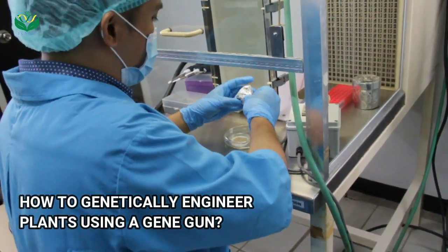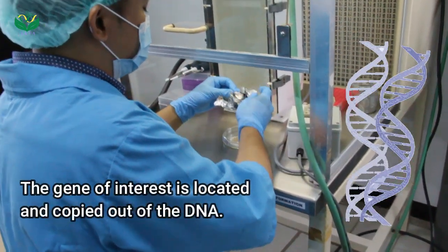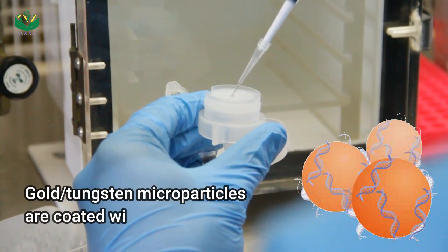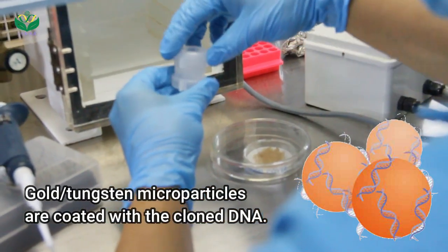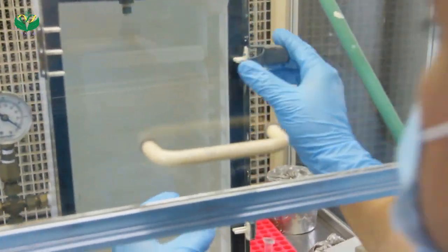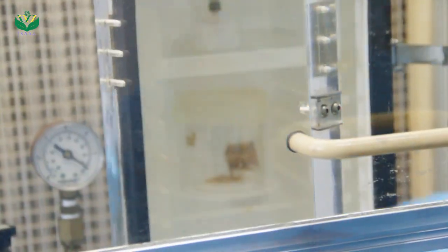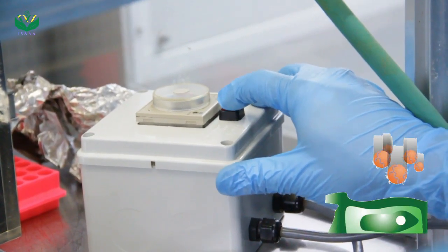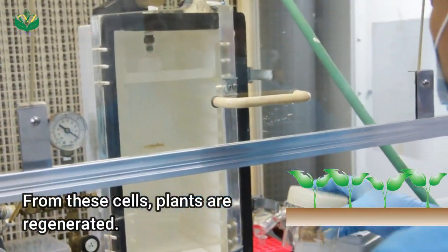How to genetically engineer plants using a gene gun? First, the gene of interest is cloned out of a DNA extracted from an organism. Then, gold or tungsten microparticles are coated with a cloned DNA. Target plant cells are fired with the coated DNA. From these cells, plants are regenerated and checked for the presence of new genetic material.